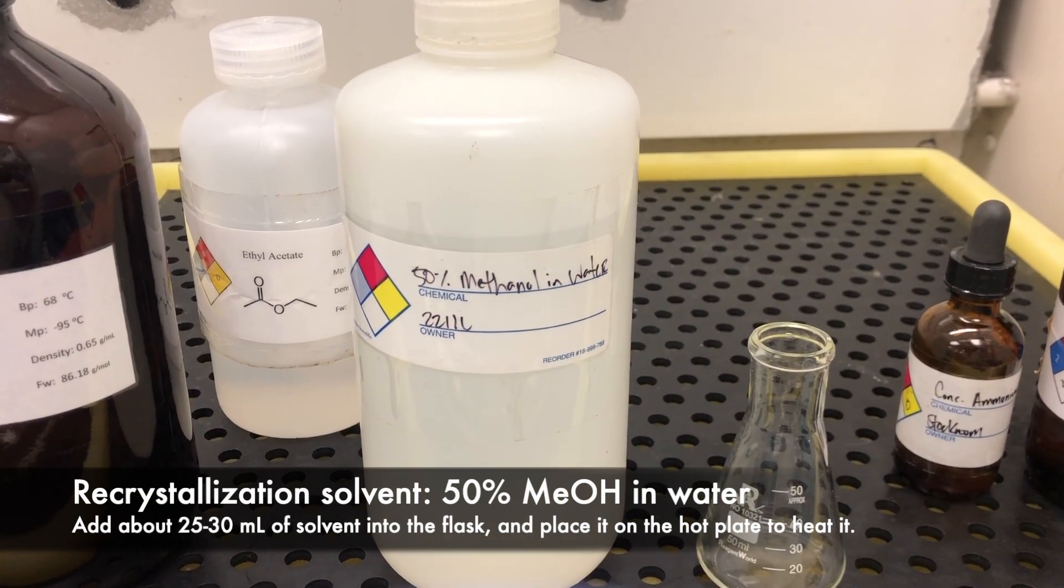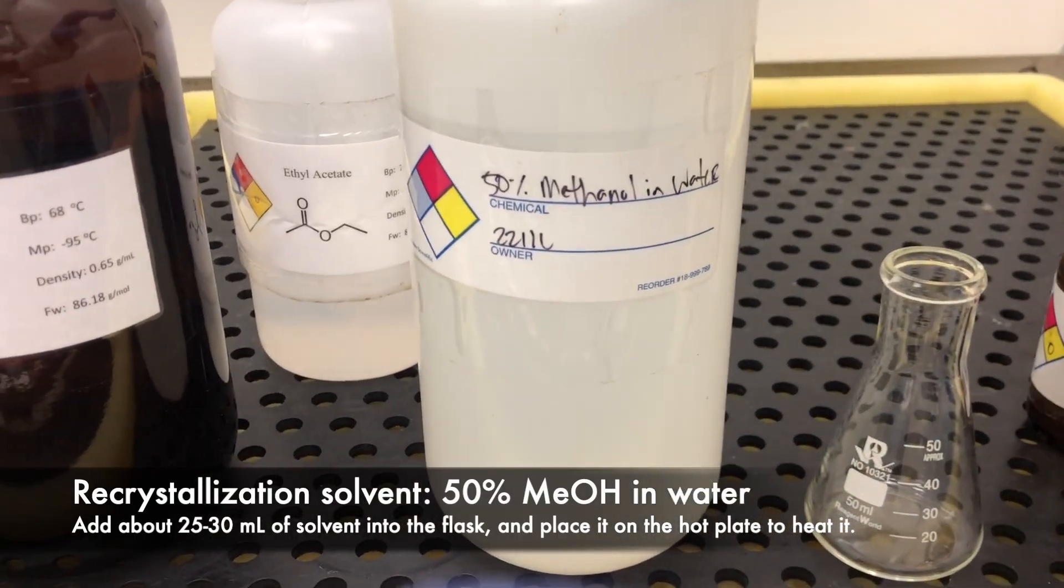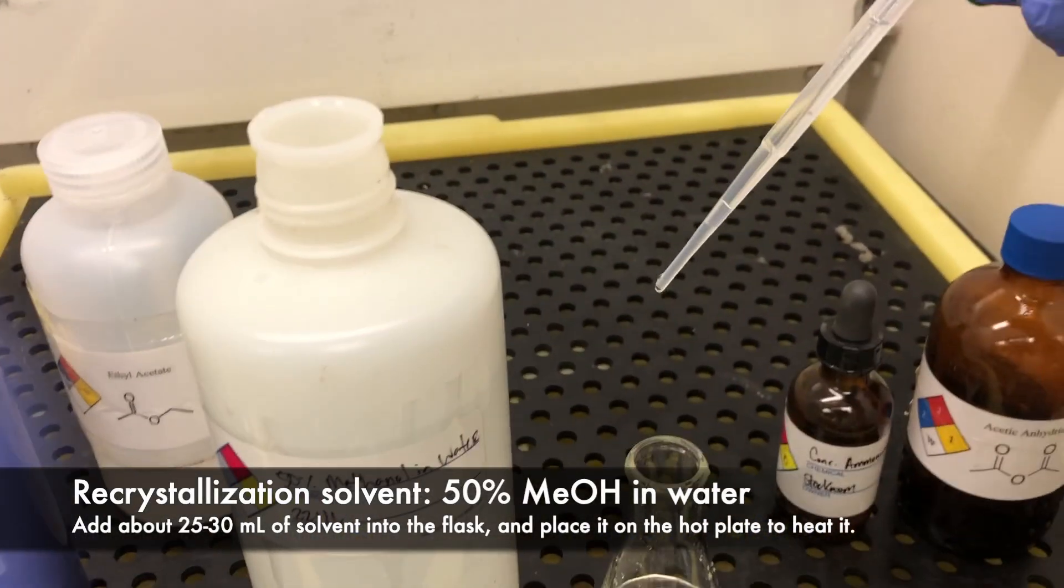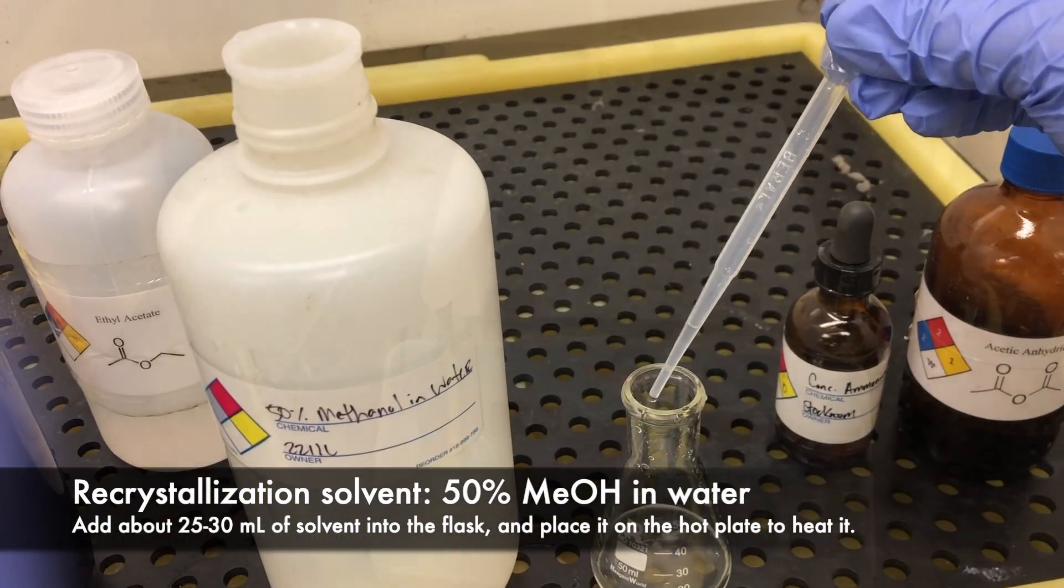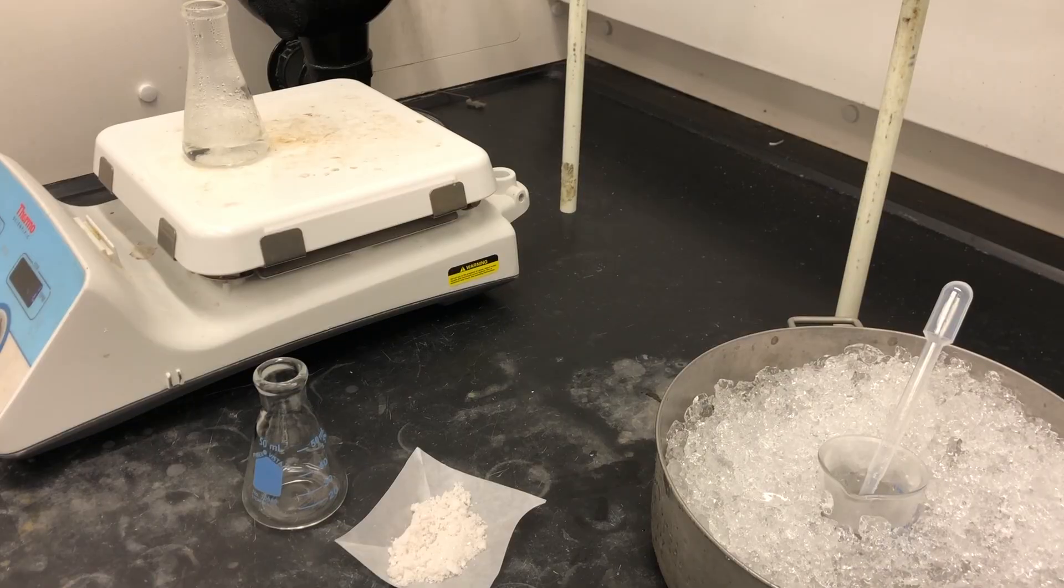We're going to be using 50% methanol in water as our recrystallization solvent. We can go ahead and heat it up.